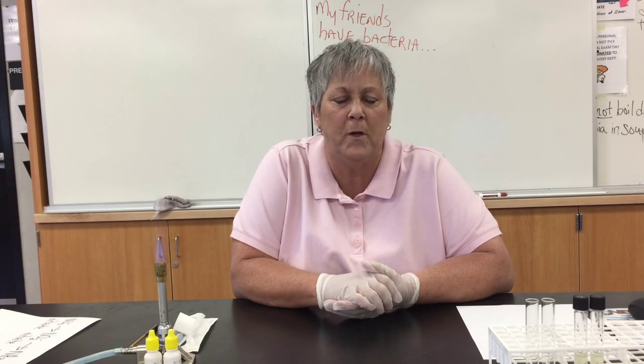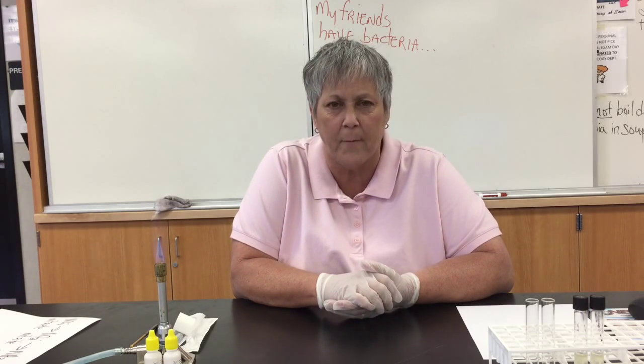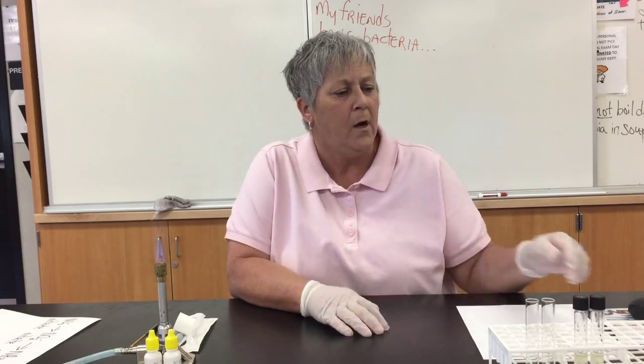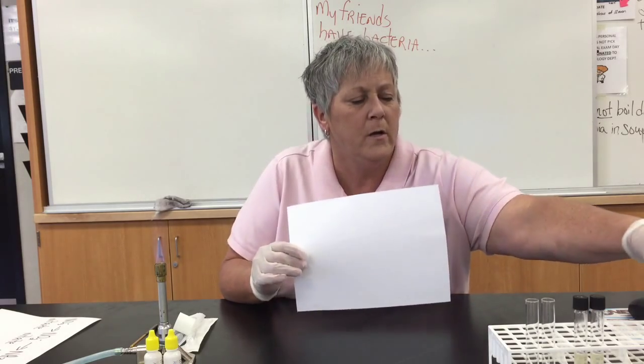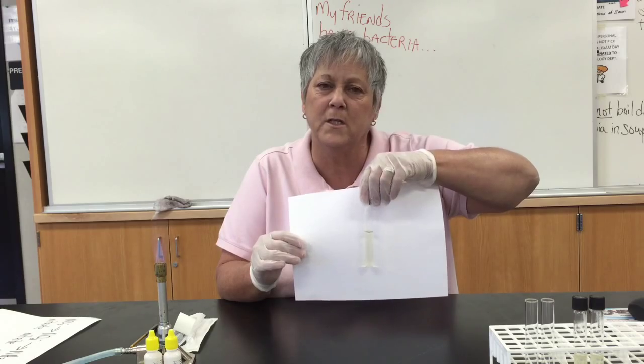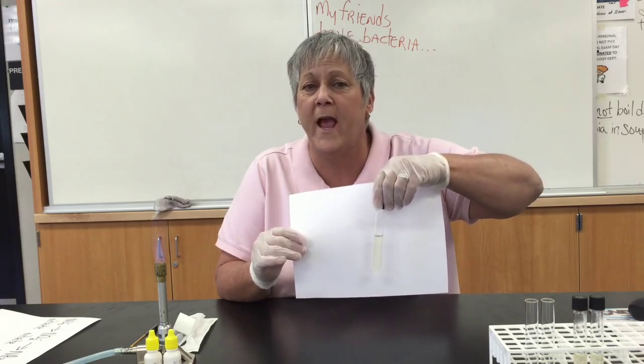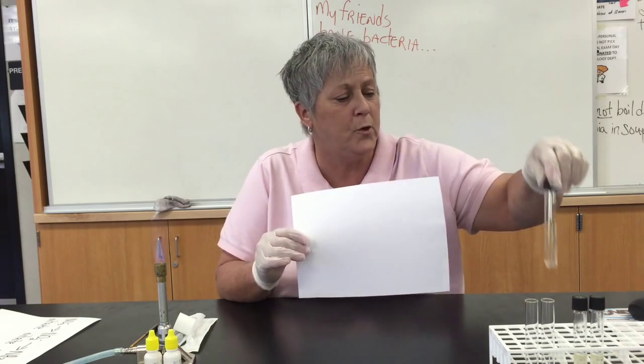We are going to just be testing to determine if the first step — nitrate converted to nitrite — was done. Here is our nitrate broth. It's essentially colorless, and contains a Durham tube to collect any nitrogen gas should it be produced.